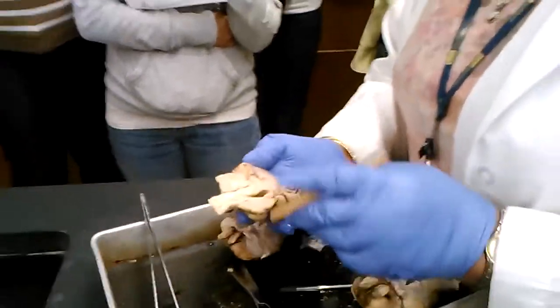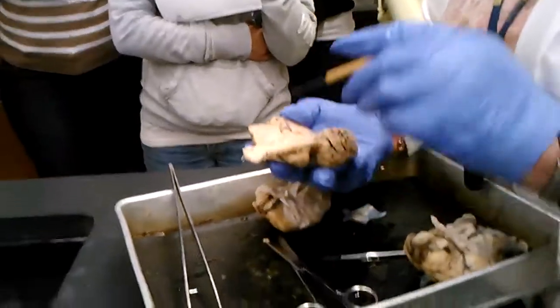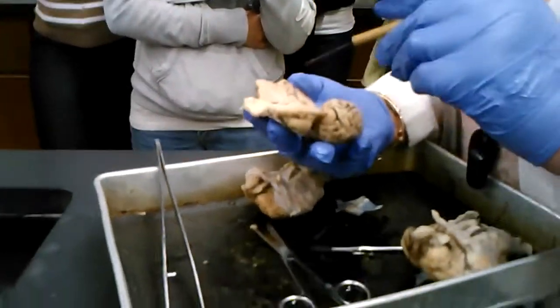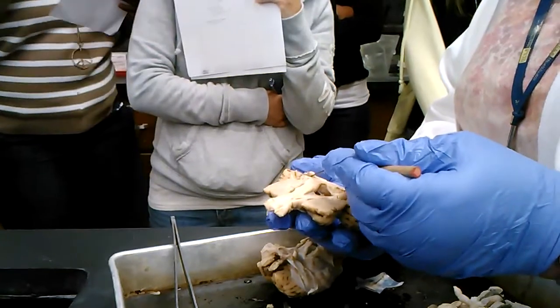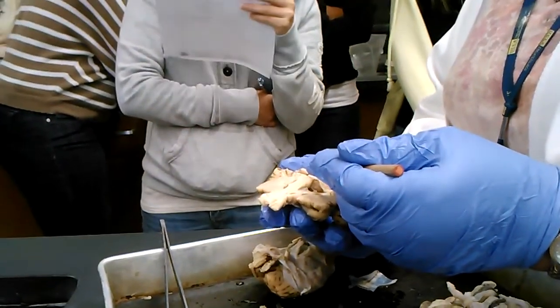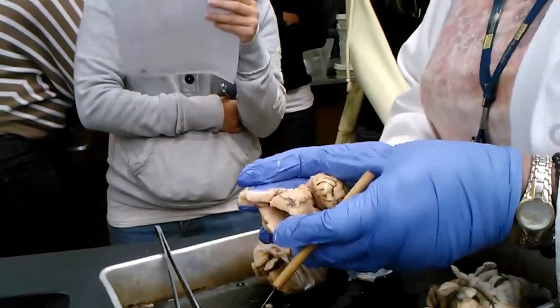Again, let's close it. This is the cerebellum. If I open it and pin something, I'm looking for the arbor vitae. And right here is the corpora quadrigemini. Location right above it, that little body that looks like the size of a pea, is the pineal gland, or the pineal body. That's the corpus callosum going around.